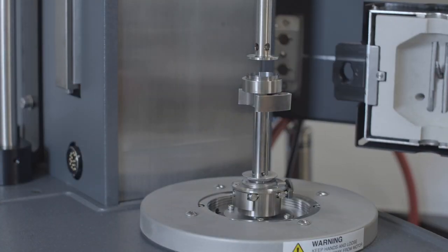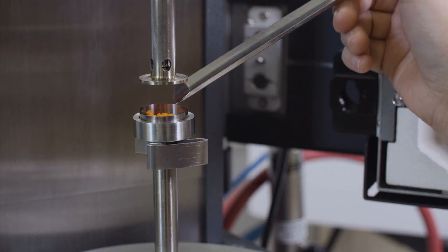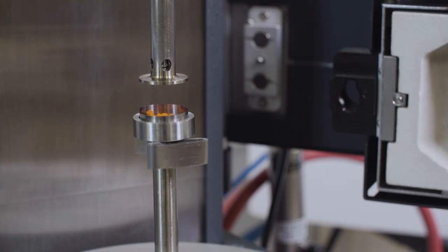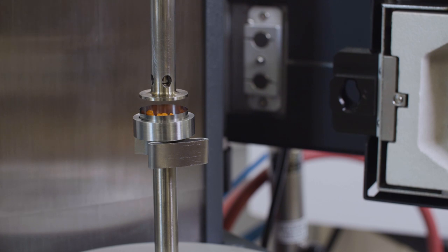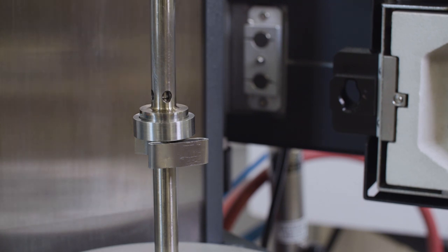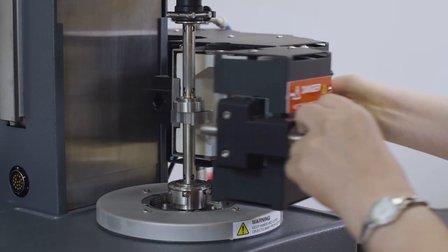After equilibration, open the FCO. Load the pellet sample into the molding ring. Lower the upper geometry until it is in contact with the sample. Close the oven immediately.